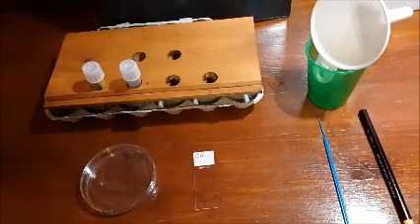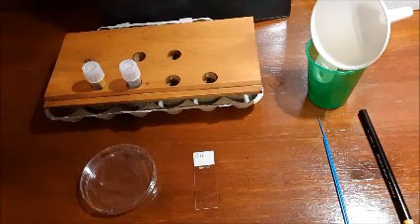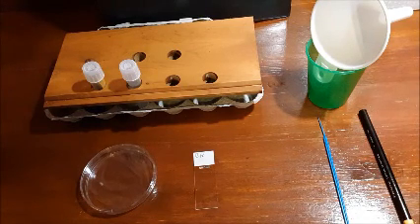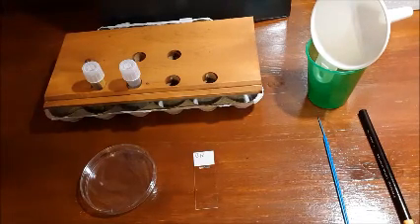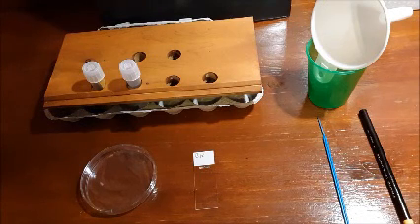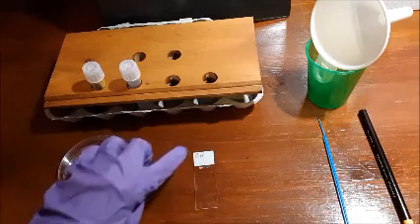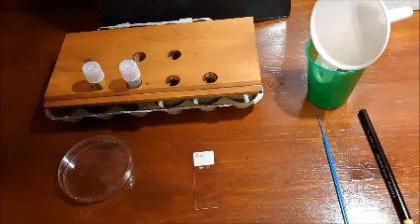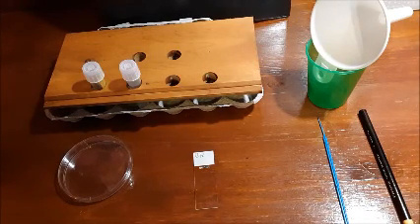So the first thing that you would do before you begin is also make sure that you have on a new pair of gloves, goggles, and your lab coat. And now that you have all the materials needed, you are ready to begin your experiment. To start off, you would label all of your plates, your slides, and your test tubes with your China marker. I've already done that, as you can see in here and on these. And once you've put your initials on it, you are ready to begin the real experiment.